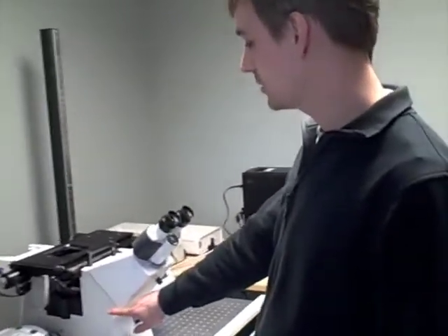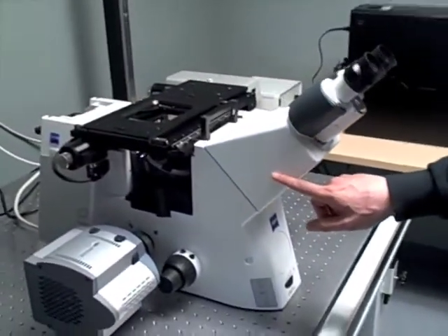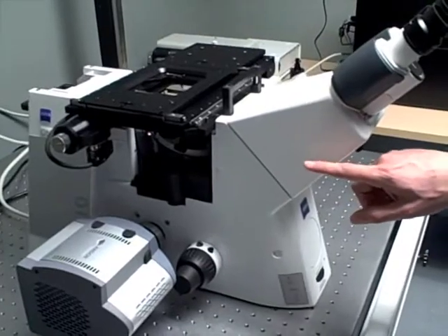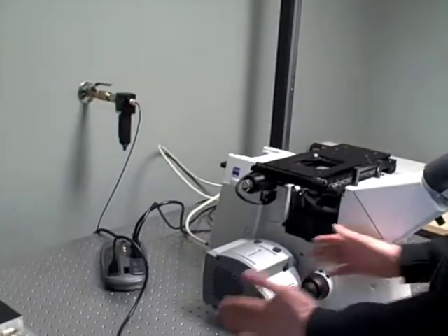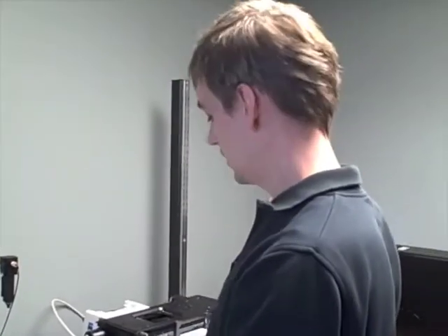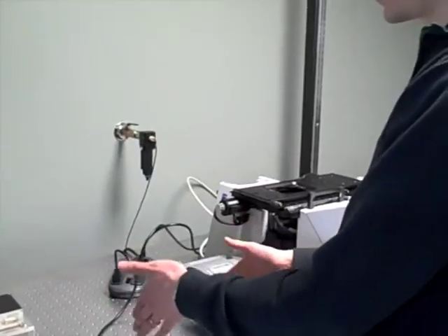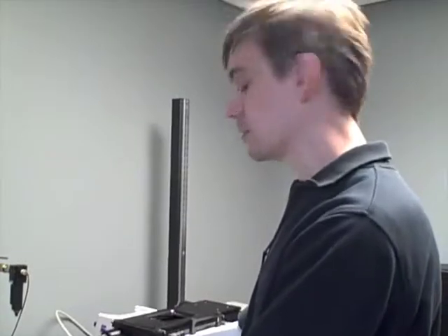It's built around a Zeiss inverted microscope chassis. The reason I picked Zeiss is because I really think they have the very best TIRF objective lens. It's that very nice objective lens that I showed you. I'm going to have two cameras. One is going to be attached to that beam splitting device that I showed you, and that camera will be dedicated to simultaneous imaging of red and green fluorophores.